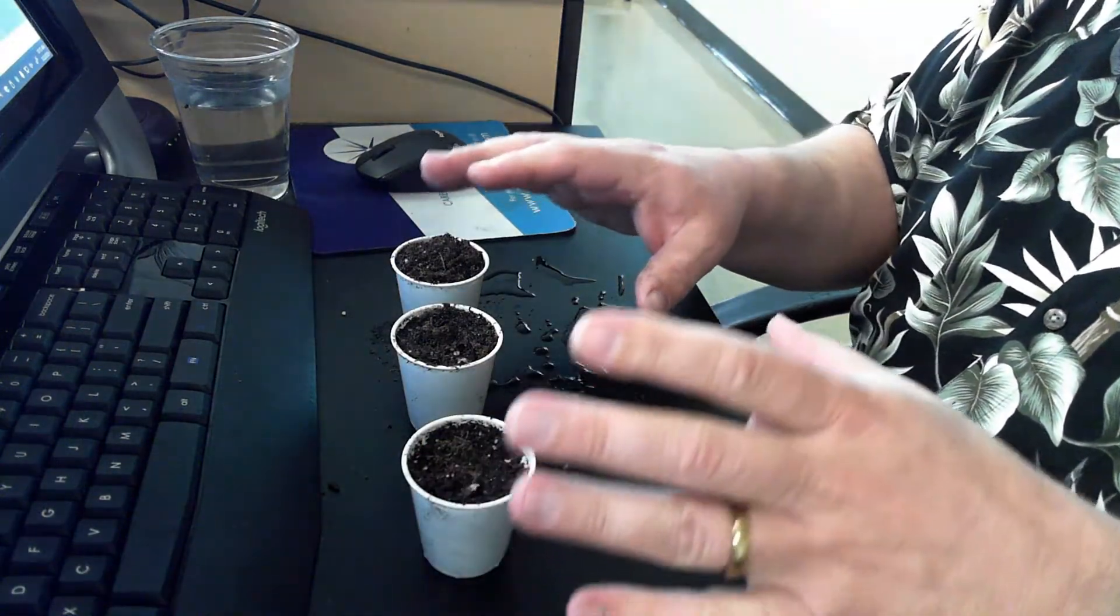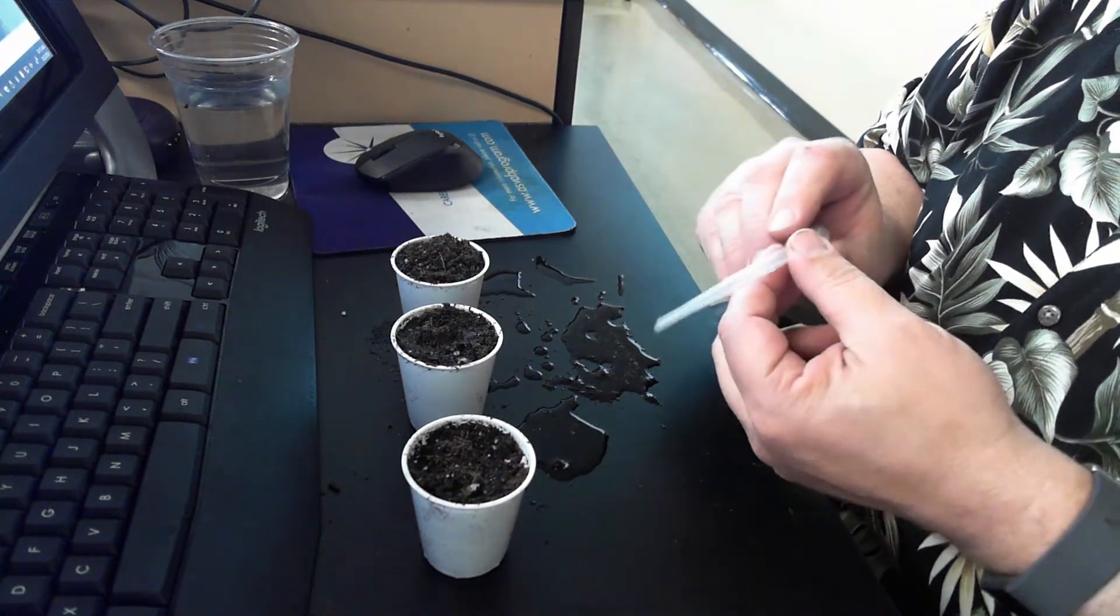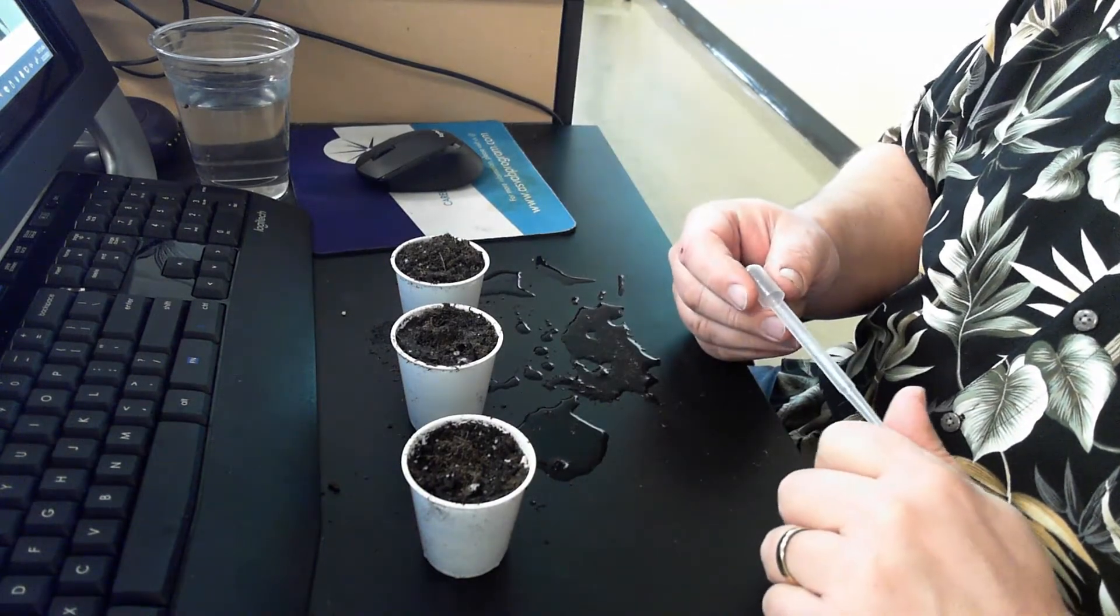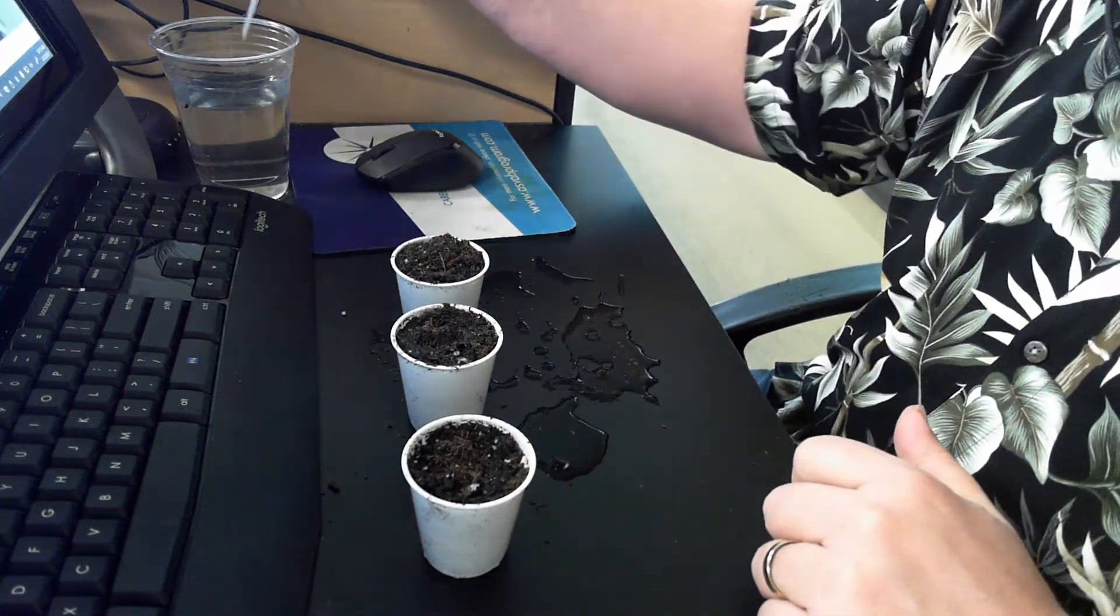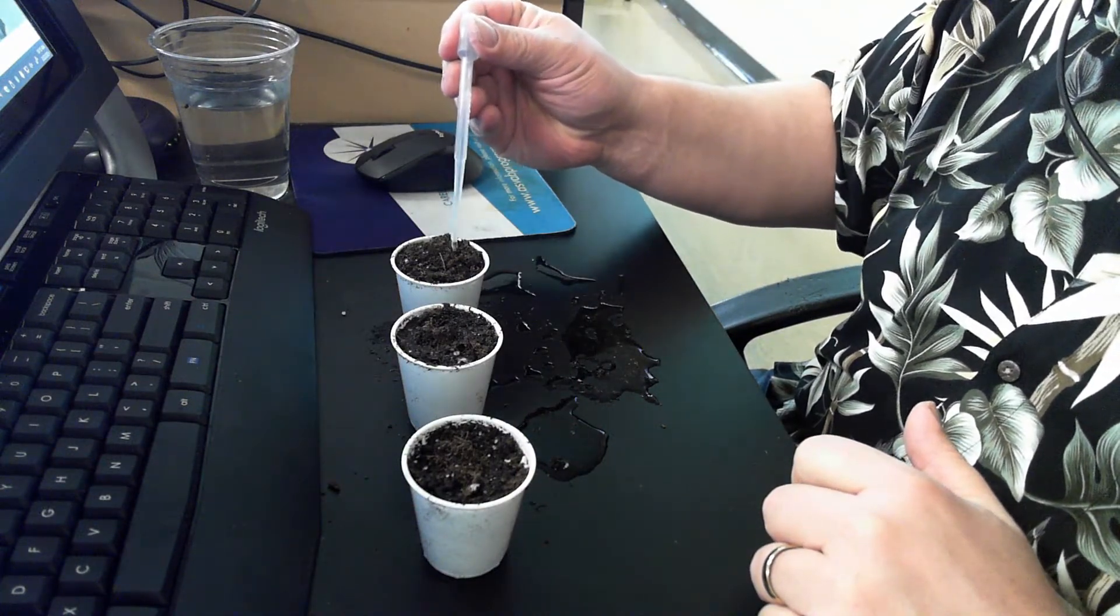So, we're set. We've got this labeled. As you water them, you're going to water them with the pipette. Once the plant has a chance to come up, I'm going to give it just a little bit more water here on the soil that I just added.